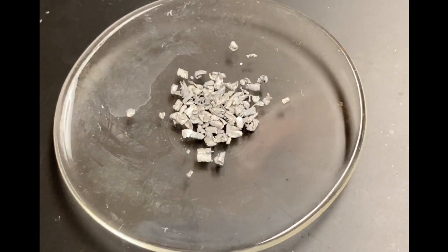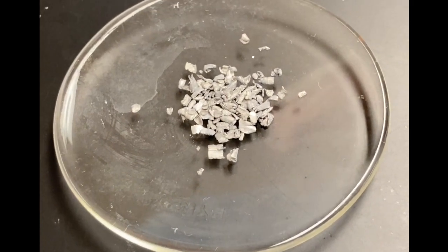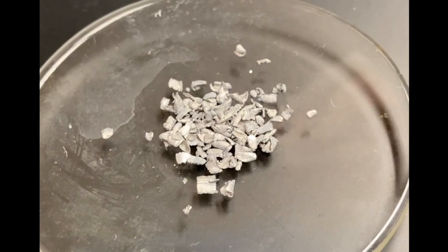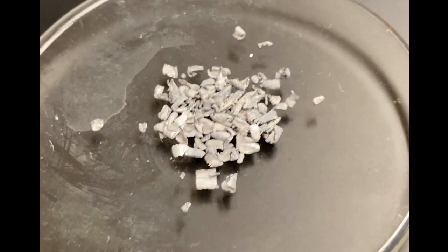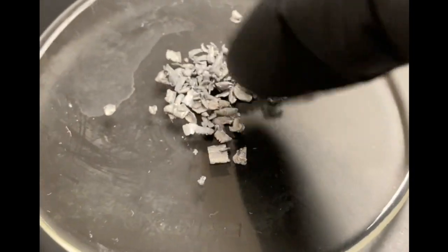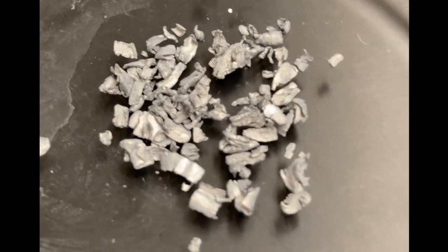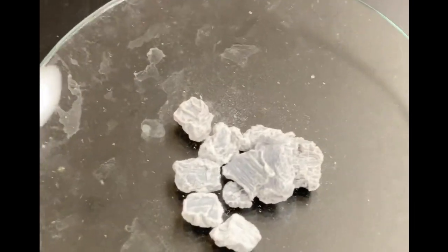All right, so we're gonna have our periodic trends demo by video today. We're gonna take a look first at each of the four metals. This is magnesium, and you can make some observations about that and fill it in on your sheet. Then we're gonna come over here. This is calcium.